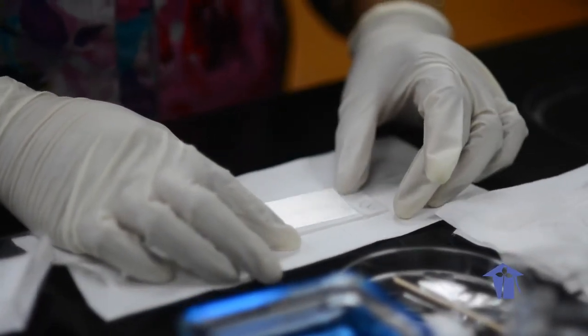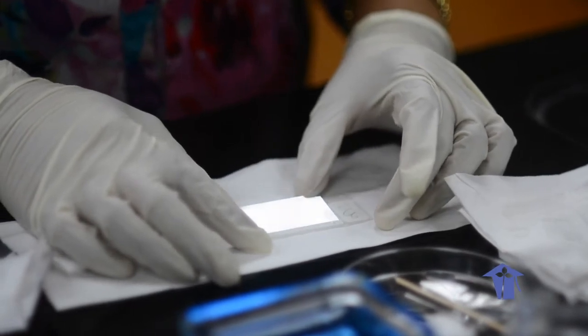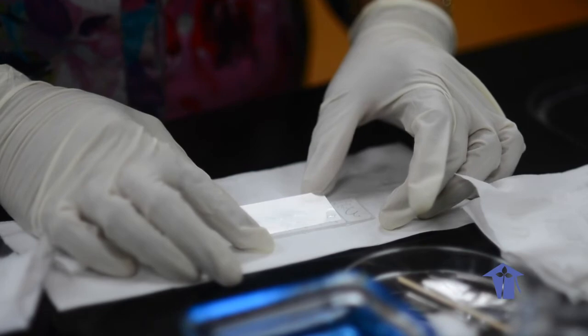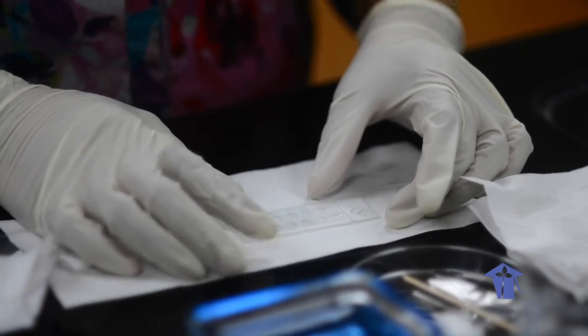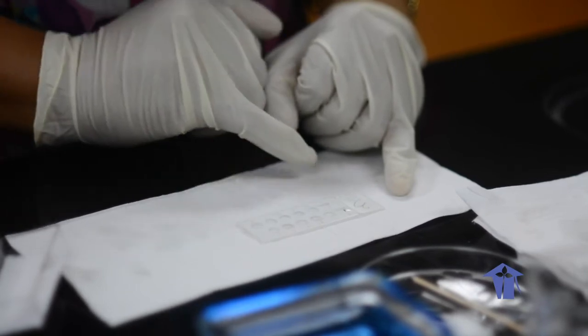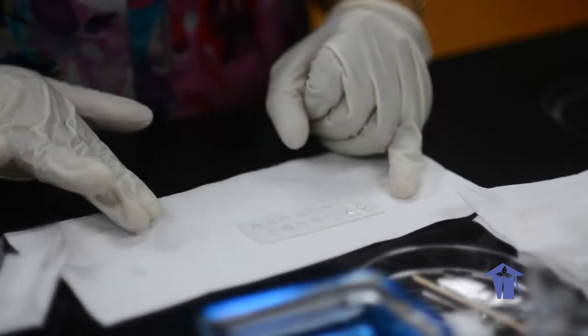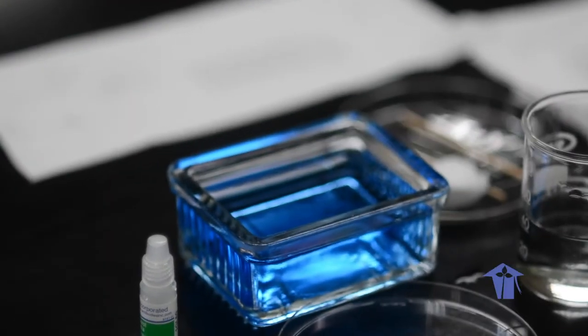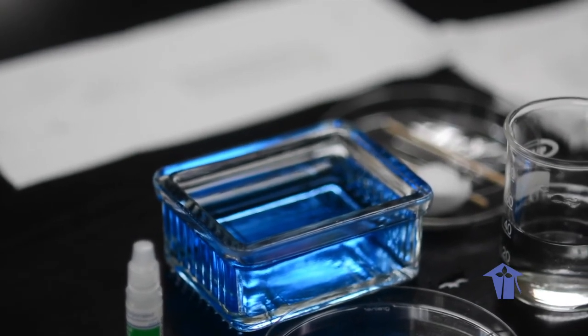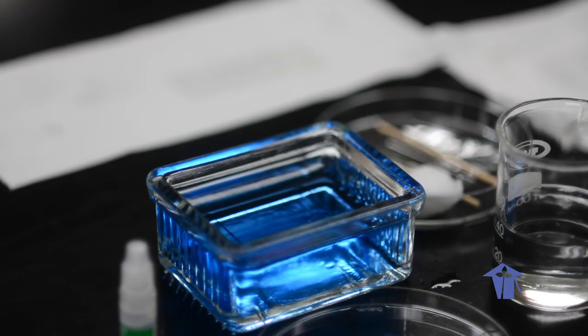The cover slip as close as you can. What we're trying to do, class, is to avoid bubbles. So now we can take our slide and use a fluorescence microscope using the 40x objective.